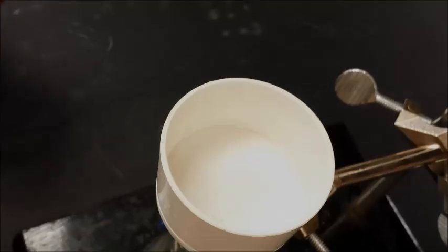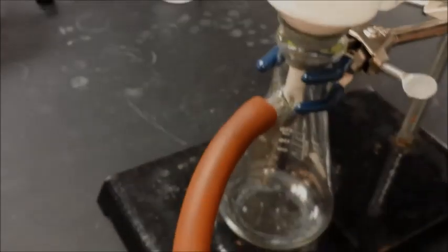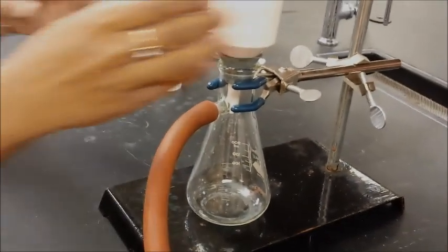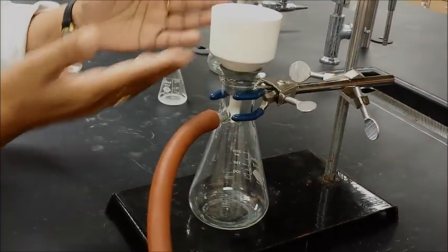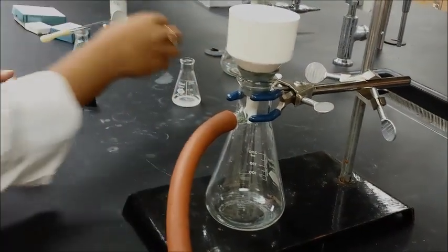And once that is wet, it means that it will actually stick to the Buchner funnel. So, your sample will actually not go through on the sides. It will go right on the filter paper.